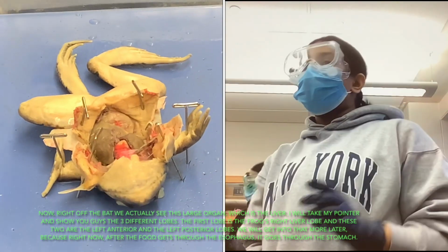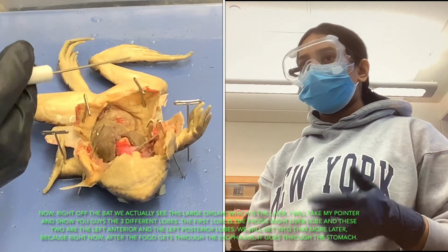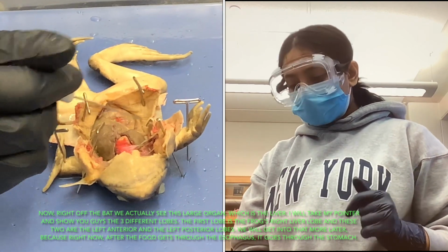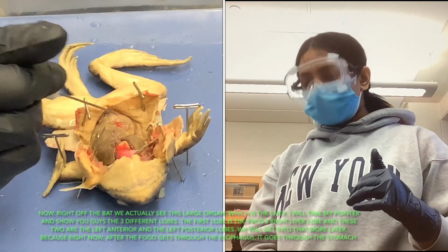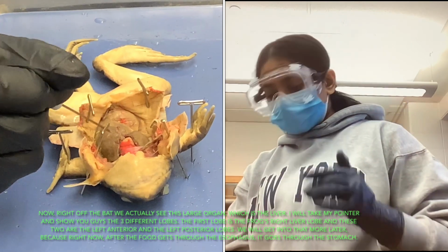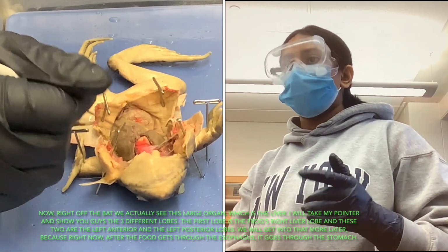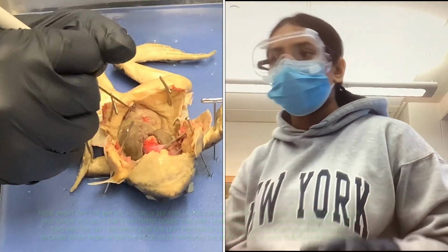Nice. Now right off the bat, we actually see this really large organ, which is the liver. And this is the liver, and I'll show you guys the three different lobes. This first lobe is a frog's right liver lobe, and these two are the left anterior and the left posterior. We'll get into that more later, because right now the food gets through the esophagus into the stomach.